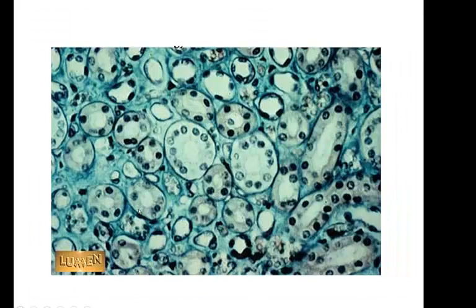What I didn't tell you about the cuboidal. You find the cuboidal epithelium always in the kidney, that's a given, because these are kidney tubules, and you find them lining ducts. But the kidney is a big one. And the biggest thing that cuboidal epithelium does is secretion and absorption. You can put secretion on your test, or you could put on your practical, or you could put absorption, either one or the other.